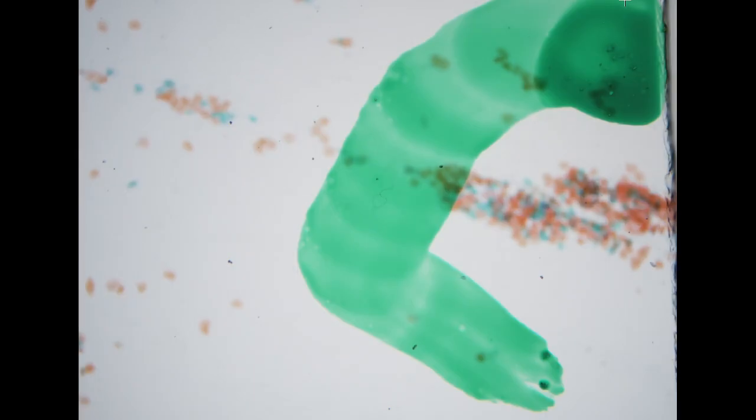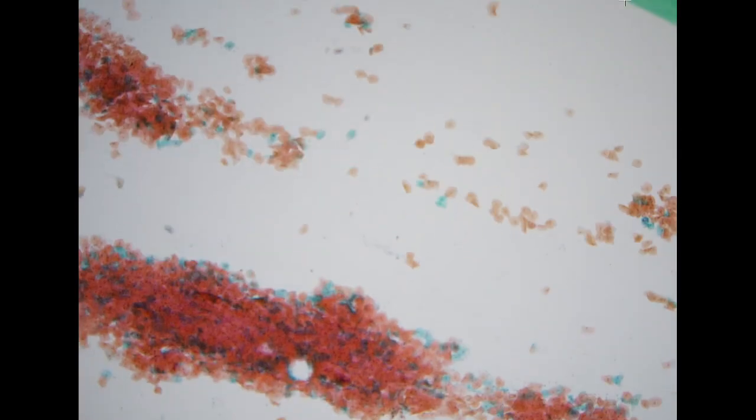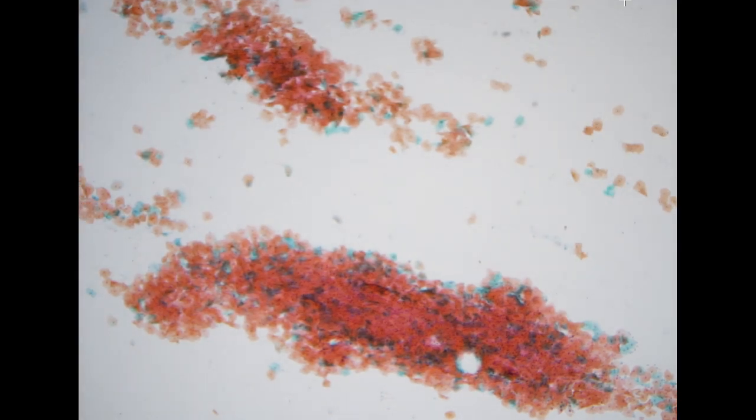So finally, let's take a look at some Pap smears. This is coming from a 37-year-old female, so relatively young. As you can see, the background mostly is superficial cells with very scant intermediate cells. So this is coming from a young patient with prominent estrogen effect. We see a lot of overlapping of the cells, and here some of the cells have increased size of the nucleus.